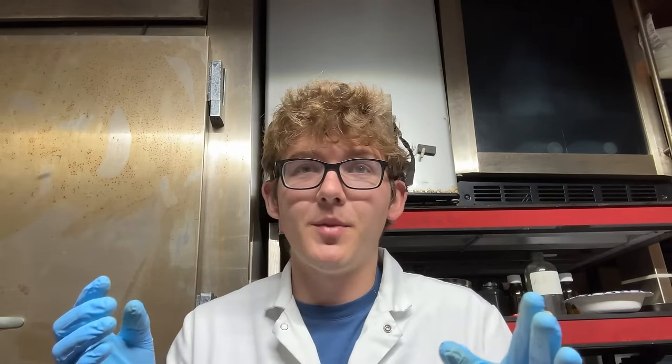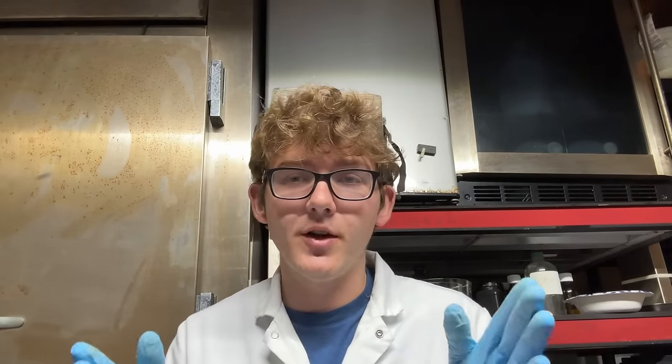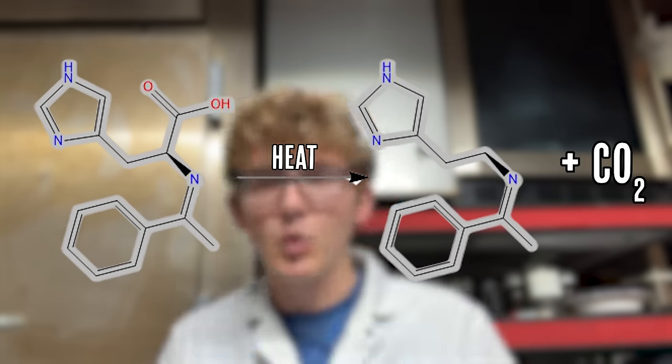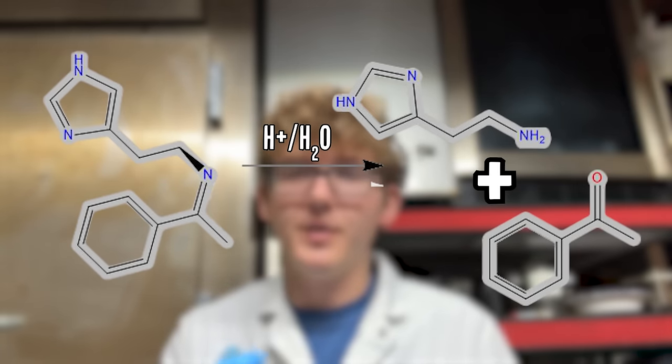Heat alone doesn't always guarantee a good decarboxylation. Some molecules will decarboxylate spontaneously at room temperature; some at 100°C; others need 200°C or more at a very slow rate — and that's what L-histidine would do. If you just heat it, it would decarboxylate but start tarring because it needs such a high temperature. So instead we're doing a ketone-catalyzed decarboxylation using acetophenone as both a solvent and a catalyst. Our acetophenone forms an imine with L-histidine, and when this imine forms it makes the decarboxylation happen much more readily. It's a catalyst because hydrolysis at the end removes the imine, forming free histamine and returning our acetophenone.